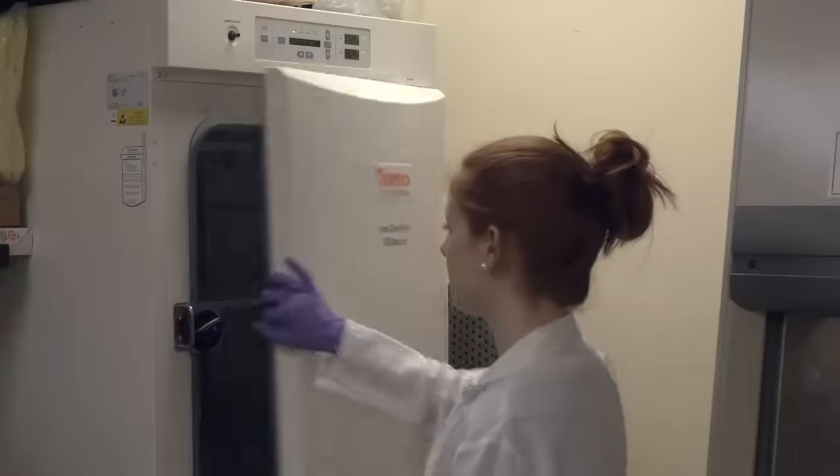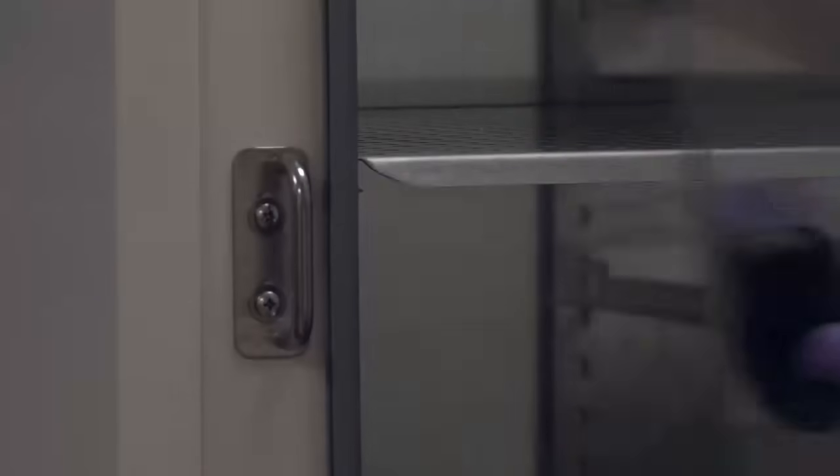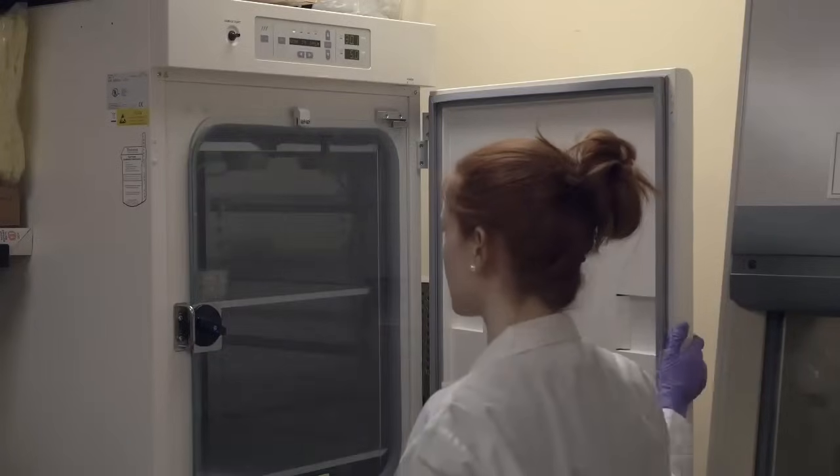Place the plates upside down in a 37 degrees Celsius incubator for 24 to 48 hours, or incubate as instructed by your teacher.